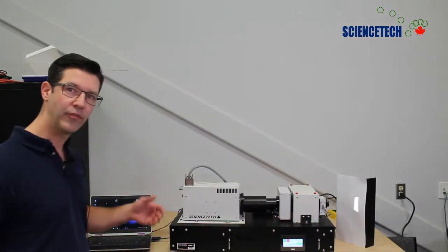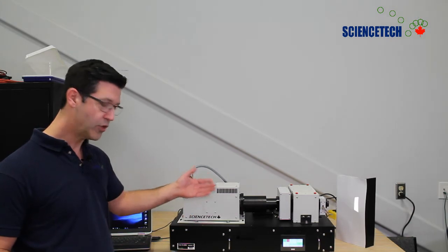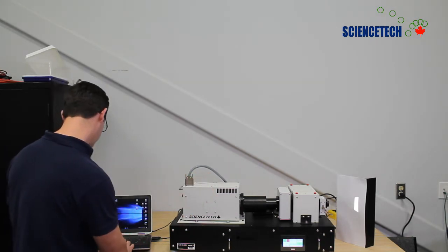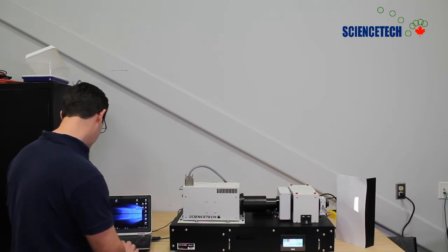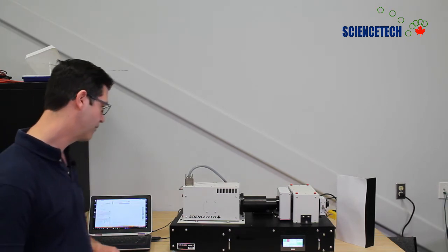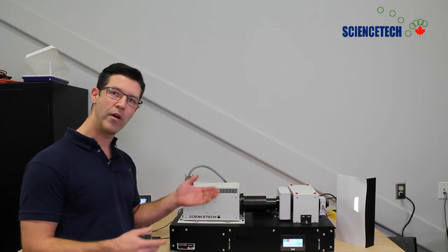Now I'm going to start up the software that we use to change the different colors in the light source. The monochromator very quickly initialized as soon as we started up.